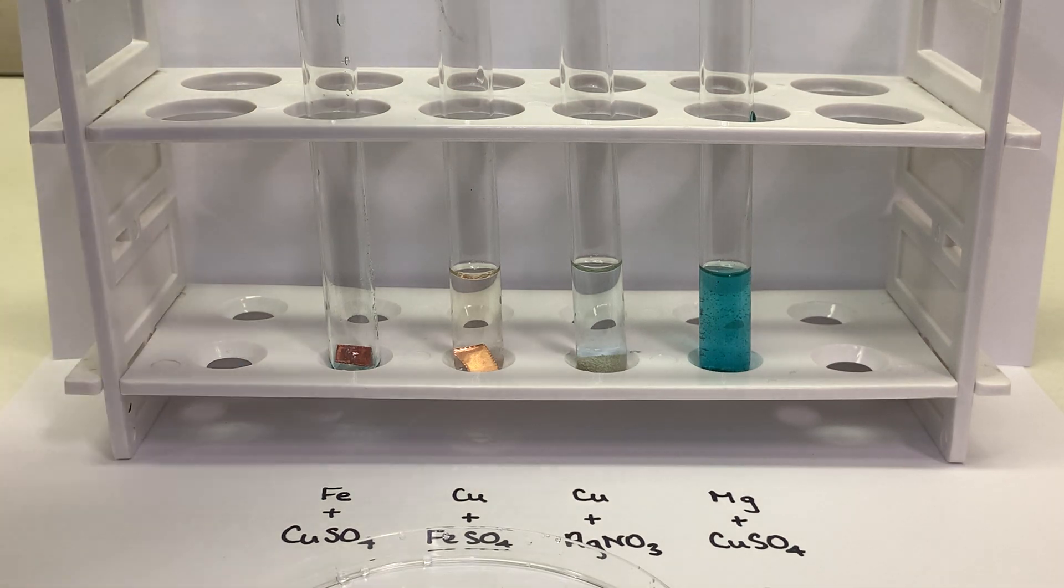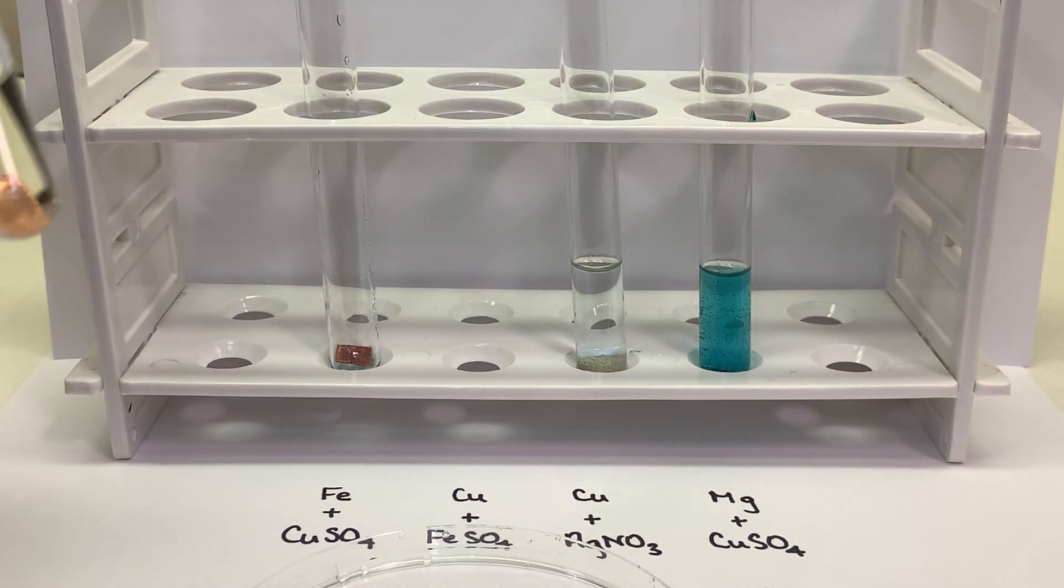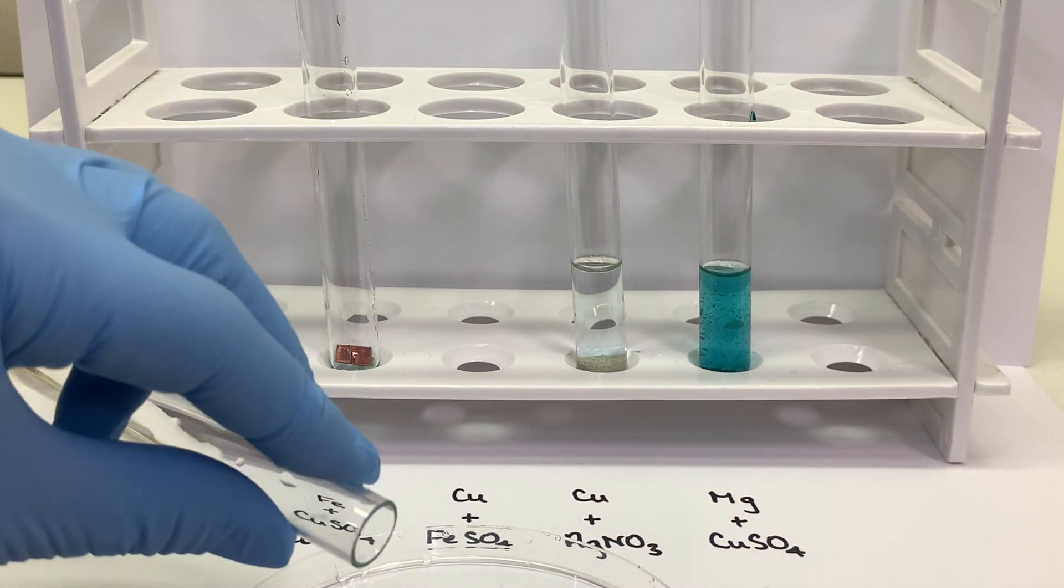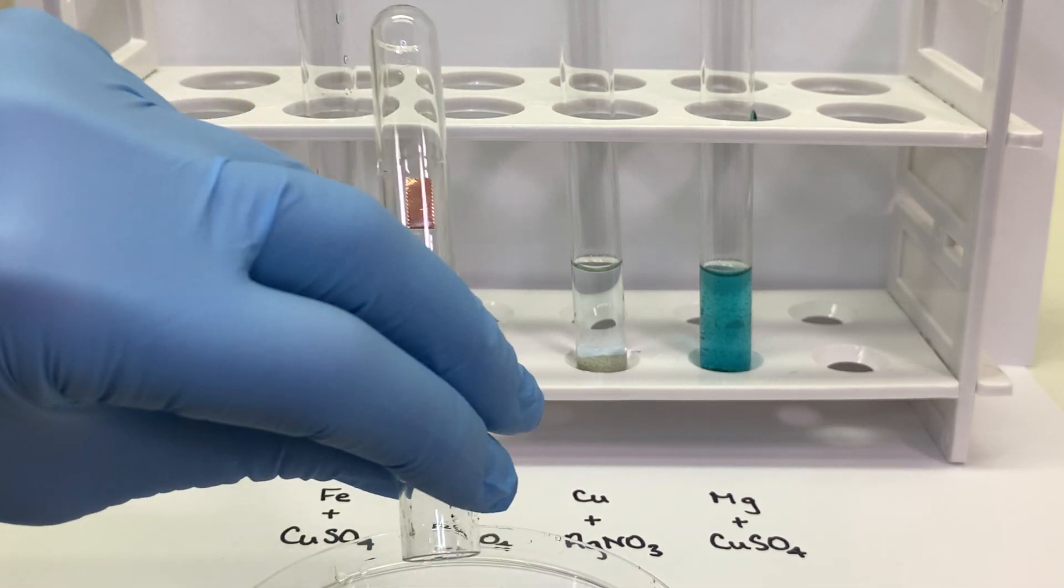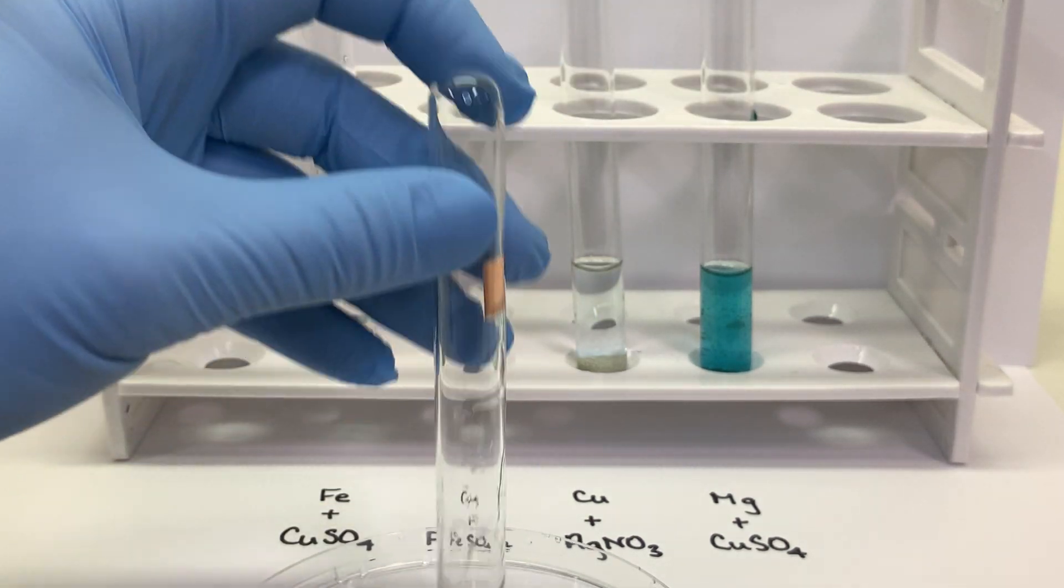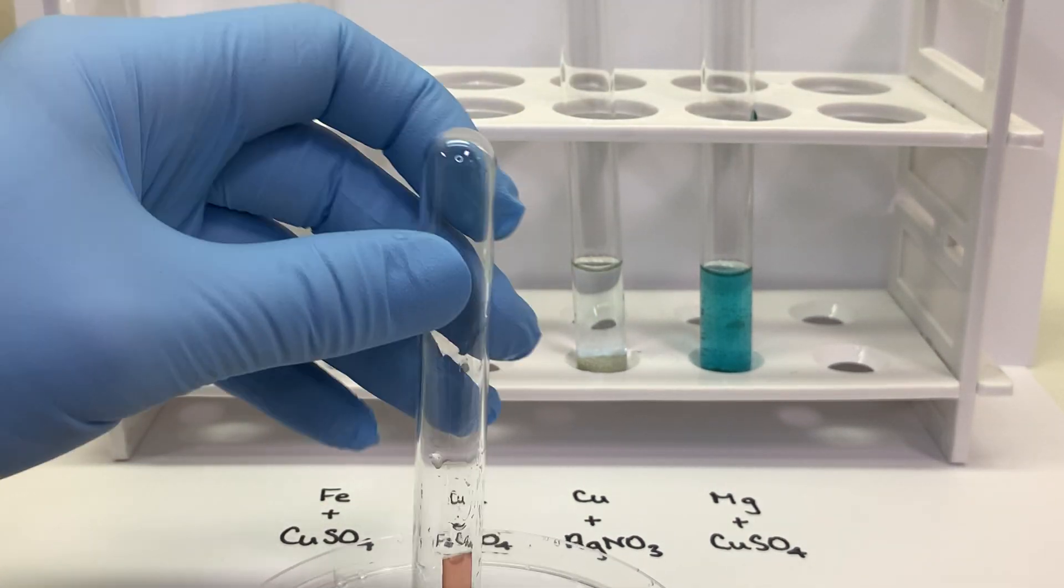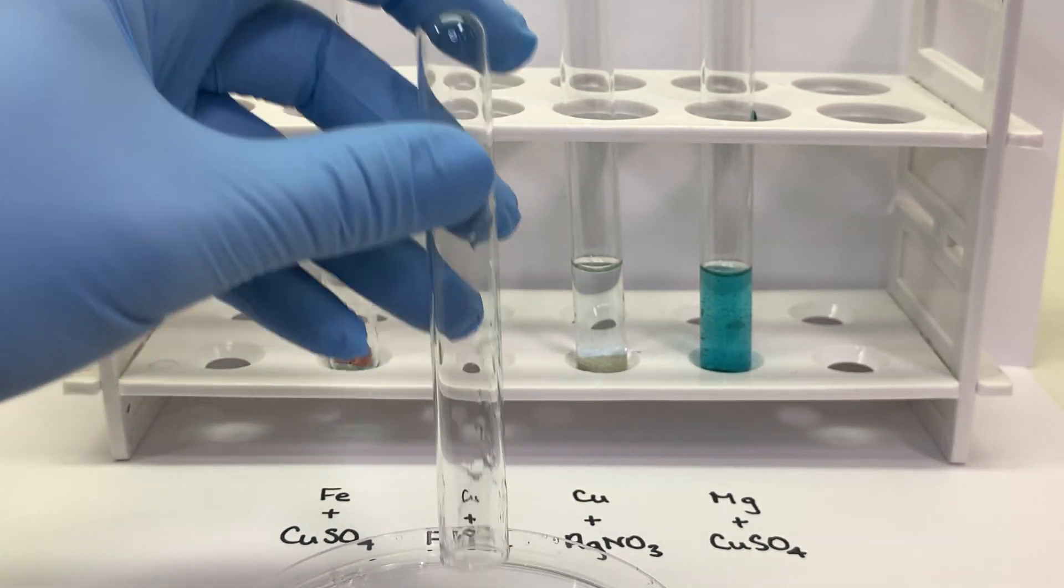Our second combination was copper metal and an iron 2 sulfate solution. So I'll try to get our products out here as best as I can so you can take a closer look at them.